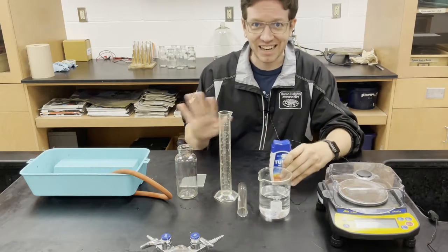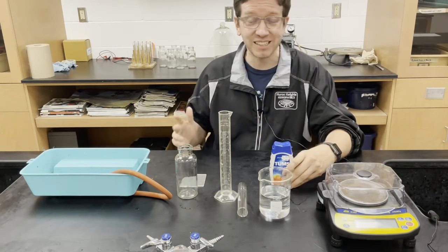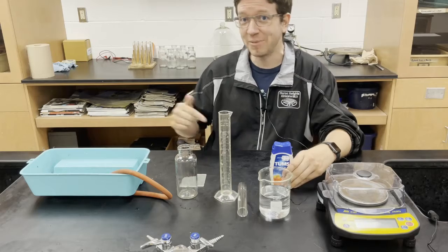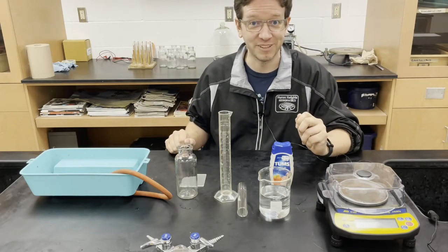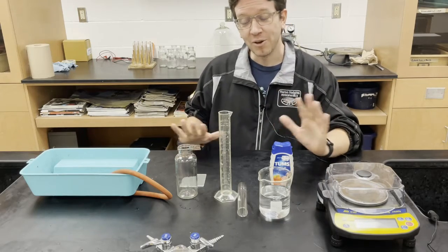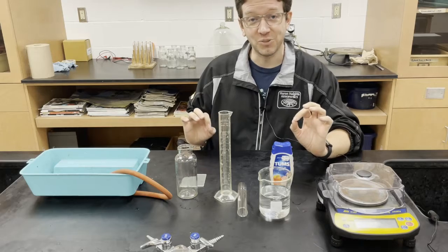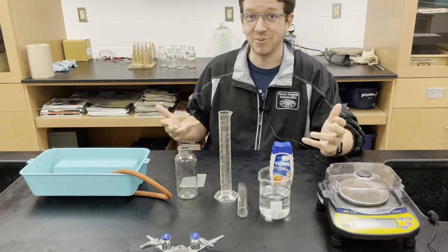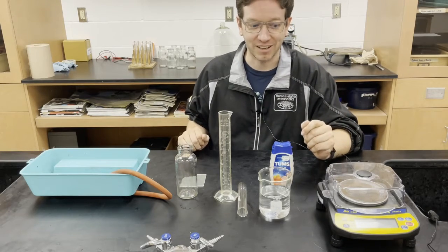There's a lot of calculations to be done and if you want to see me do those calculations, let me know in the comments and I'll make a separate video for that. But for this we are going to do the measurements and get the data that we need to actually do those calculations.